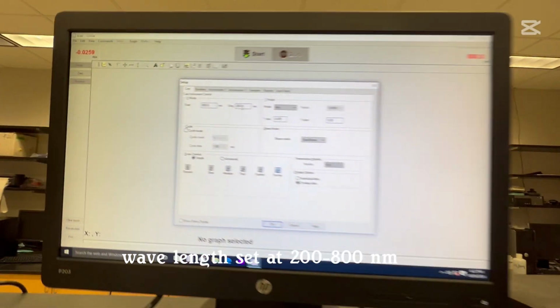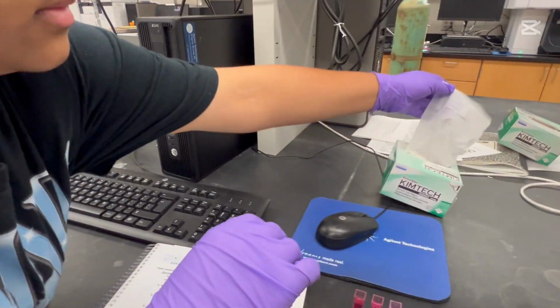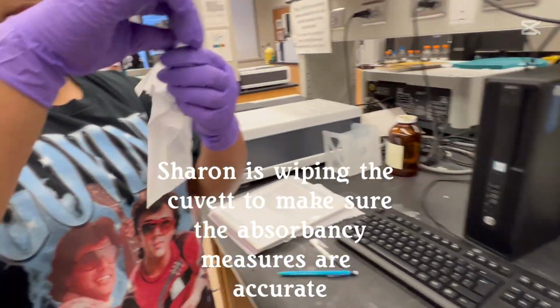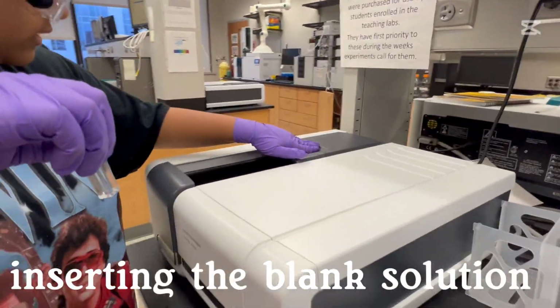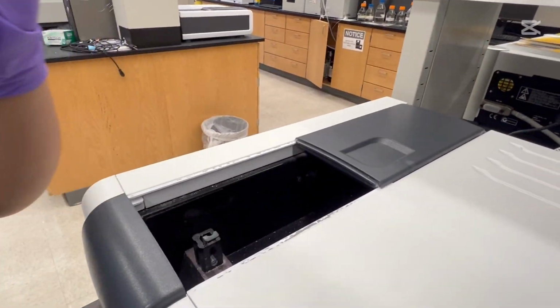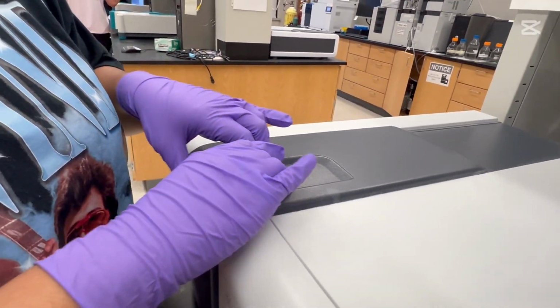Okay, it's 800 to 200. Use a wipe. Open this. I forgot which direction it goes. Close it up.